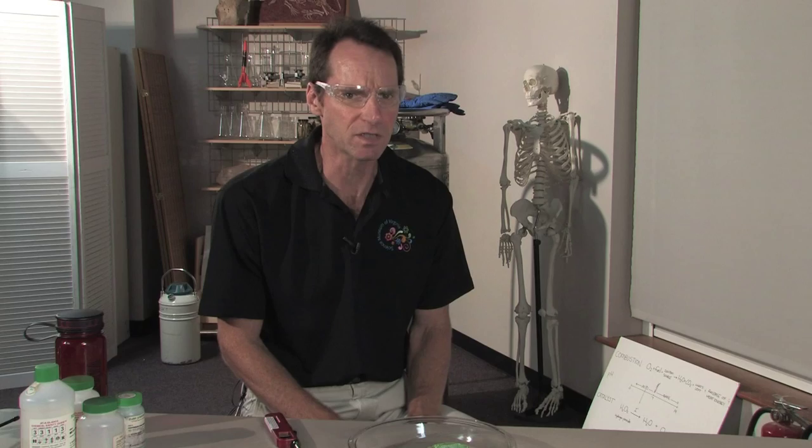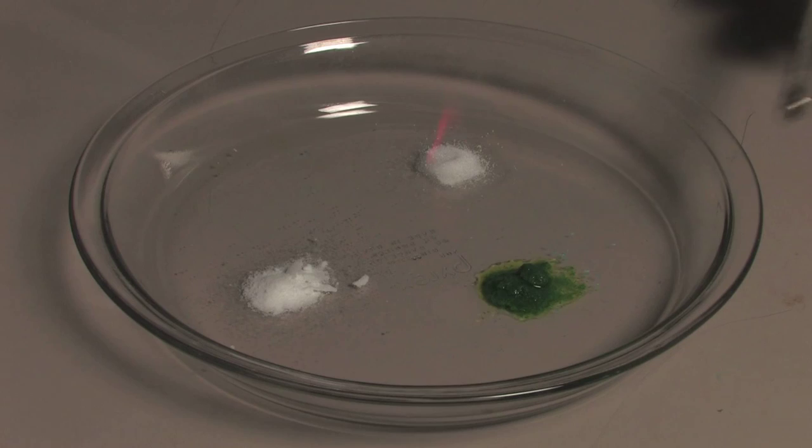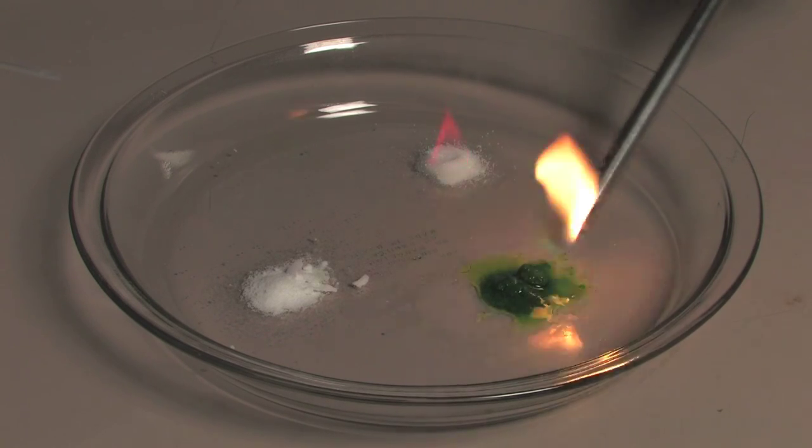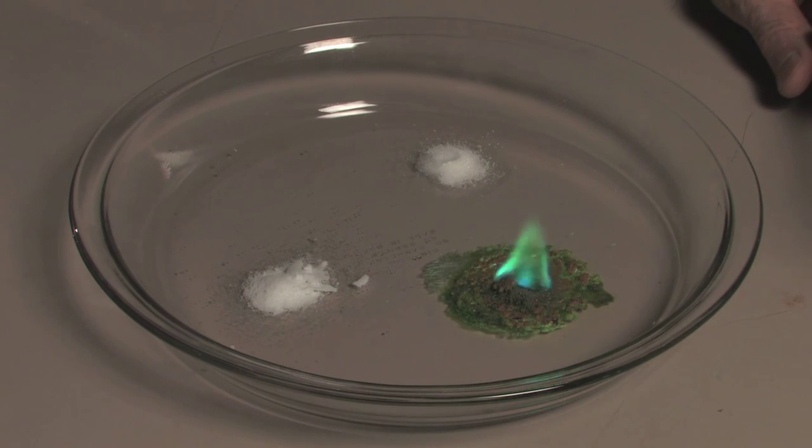Let's try our second material, the copper chloride. Wow, there's a reaction. There's a green flame.